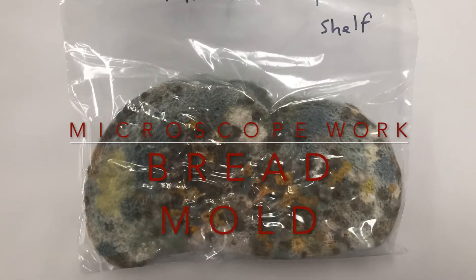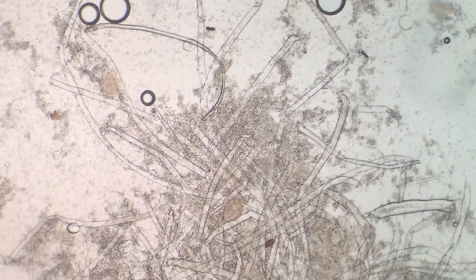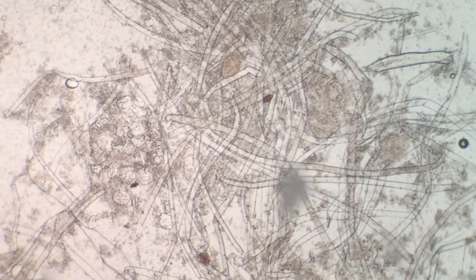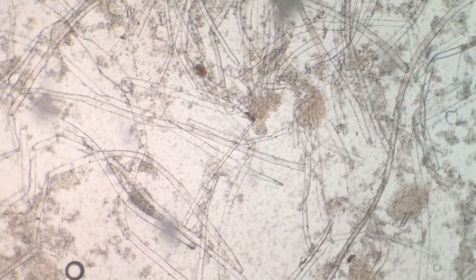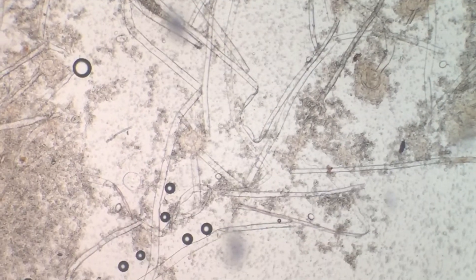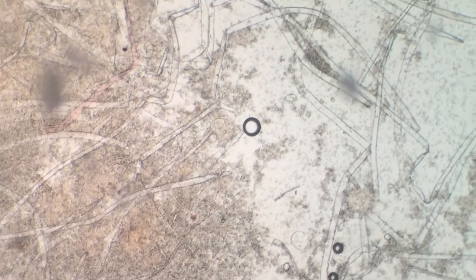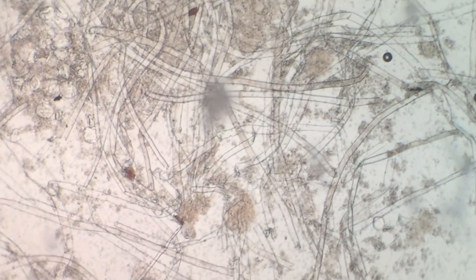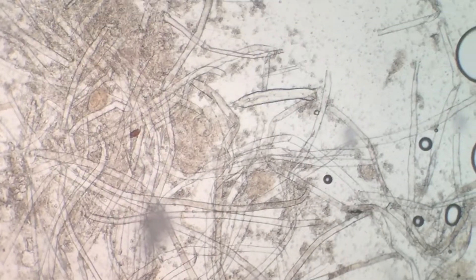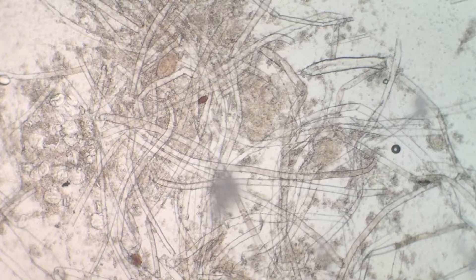We're going to look at some moldy bread under the microscope. I took a small pinch of the mold, added it to some water on a slide, and this is what we see under high power 400X. Now individually these little strands are going to be called hyphae, but collectively they are going to be called mycelium — kind of like a twig versus a branch when you're looking at a plant. So that is our microscopic view of the fungus under high power.